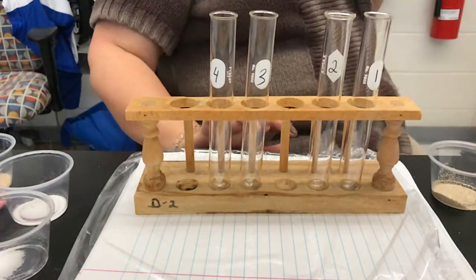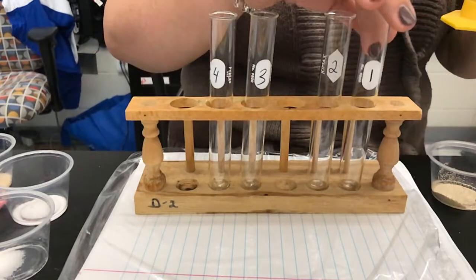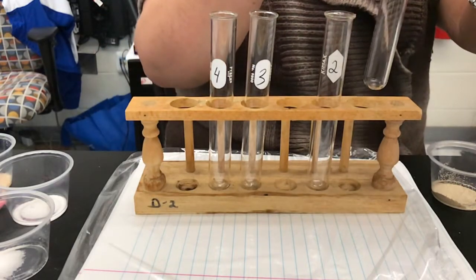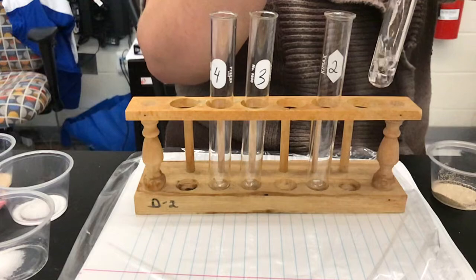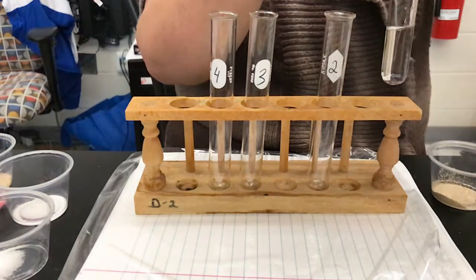All right, so test tube number one, we have our water — 10 milliliters — and we're going to pour it into our test tube.